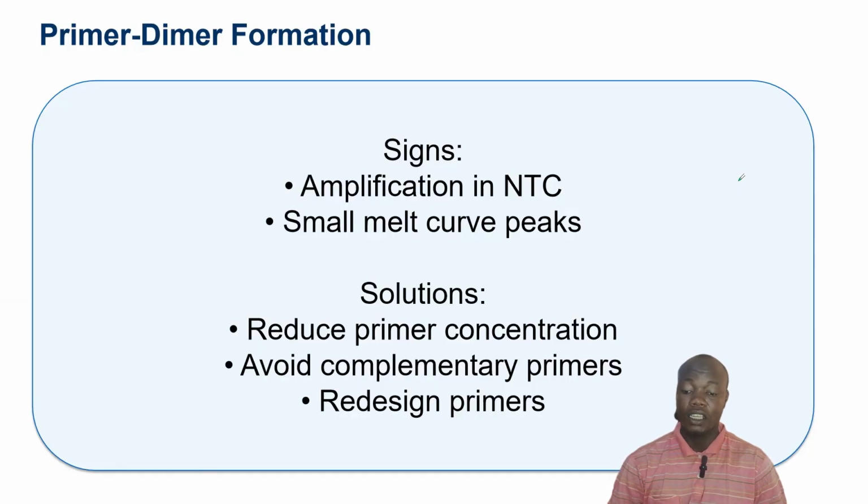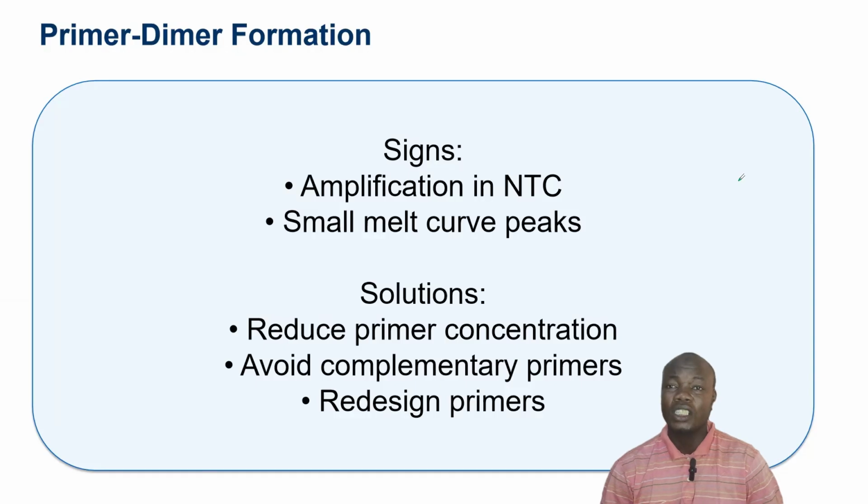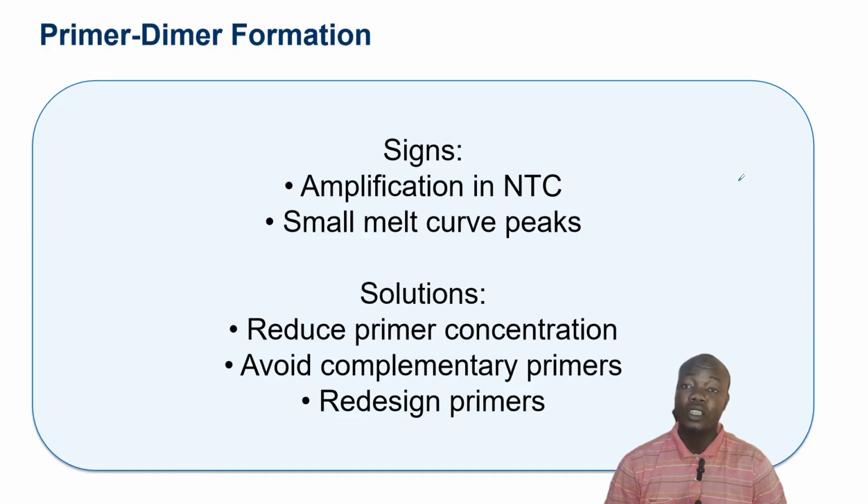And then another thing is that primer dimer formation is associated with some signs. Number one, if there is primer dimer formation, possibly there will be an amplification of the non-template control, that is NTC, and there will be a small melt curve peak. So sometimes small melt curve peaks are formed. What are the solutions to this primer dimer formation? Number one is to reduce the primer concentration. If you reduce the concentration of the primer, then there is a likelihood that you are not going to have primer dimer formation.